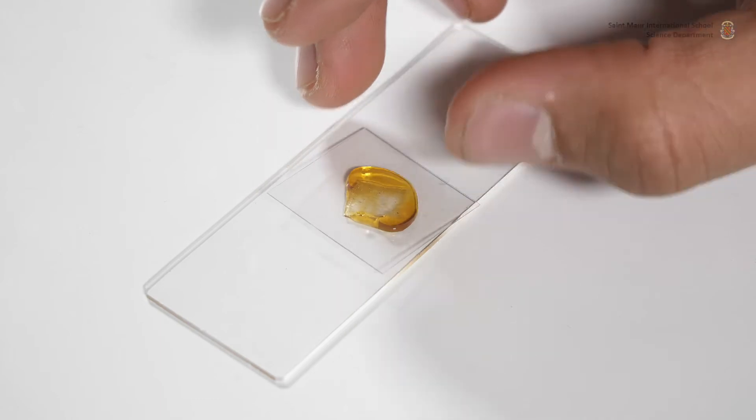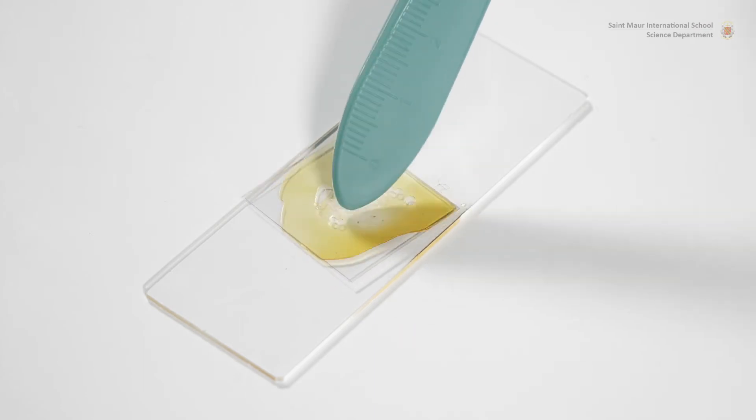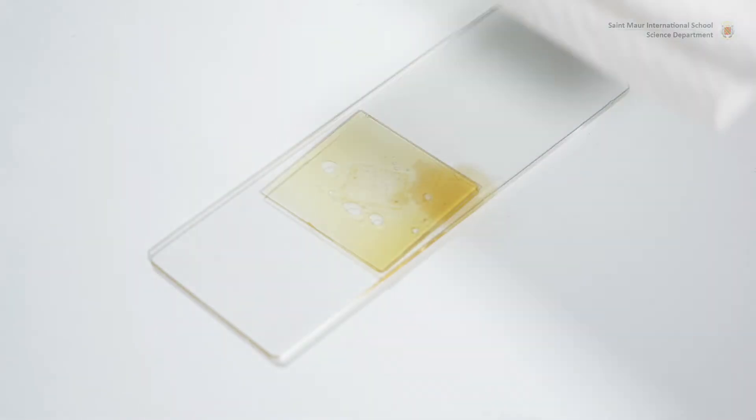Place the cover slide and tap gently to remove any air bubble. Remove the excess iodine with tissue paper.